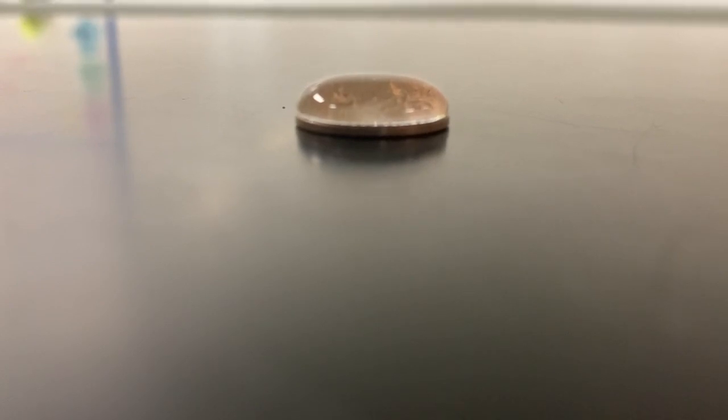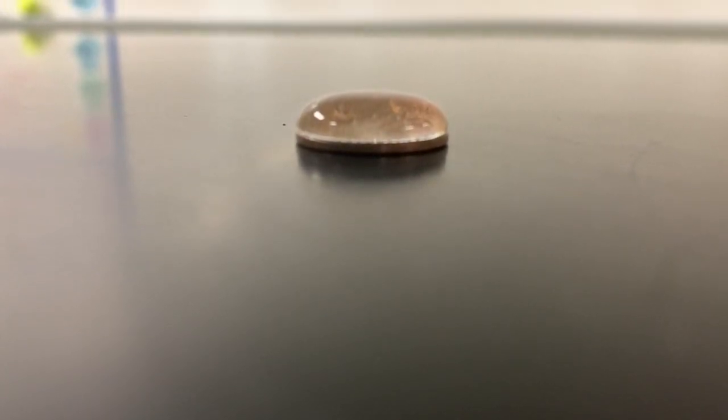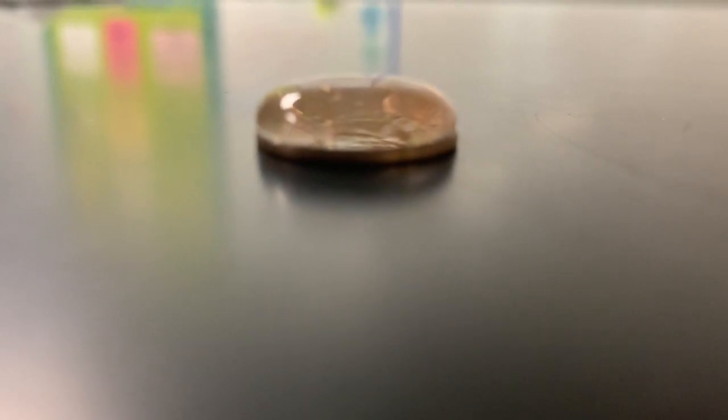Now again, look how that bubble has really taken a full mass on top of the penny. It's still just reaching the edges now on all sides. The front side, you can't really see it too well. I'll try to adjust a little bit for you, but the focus can't really gain it. The front side is starting to kind of spill over the edge.